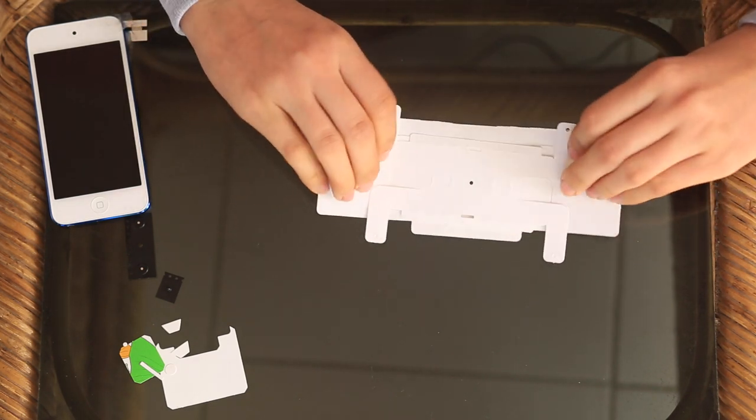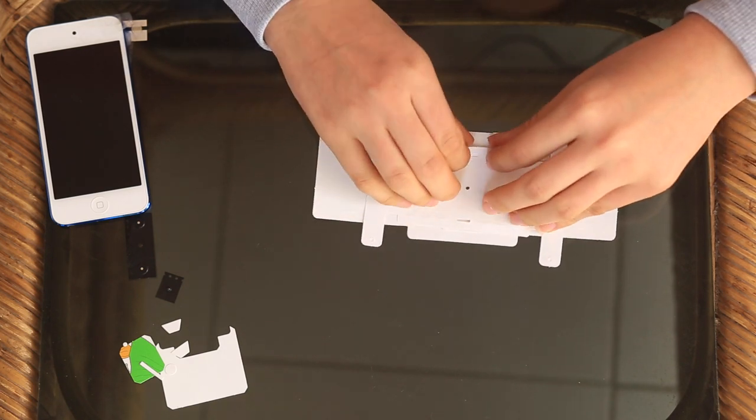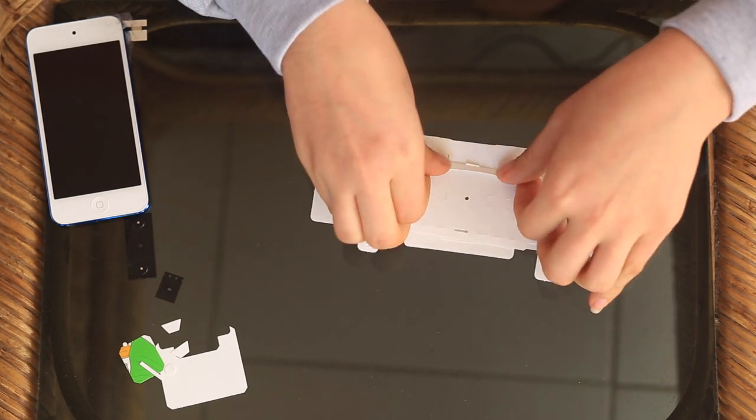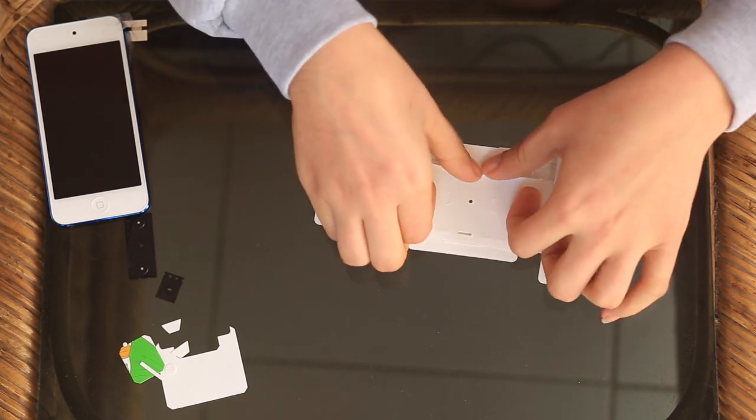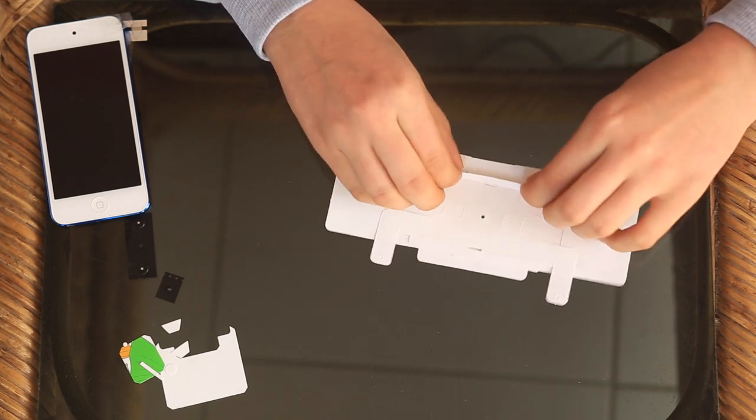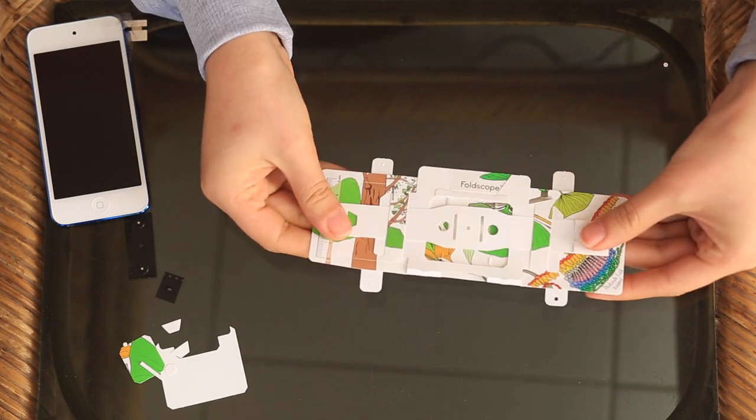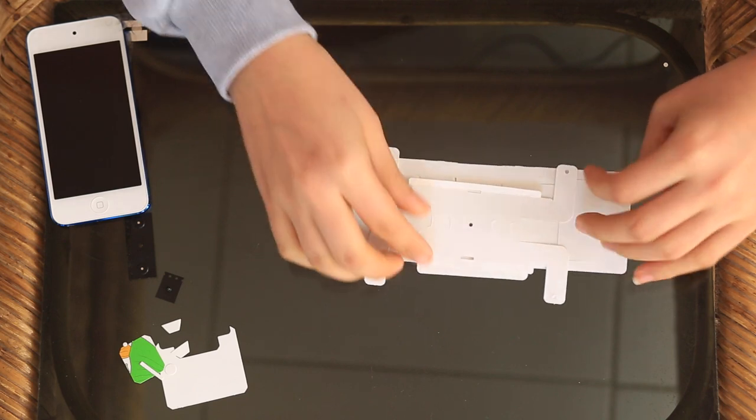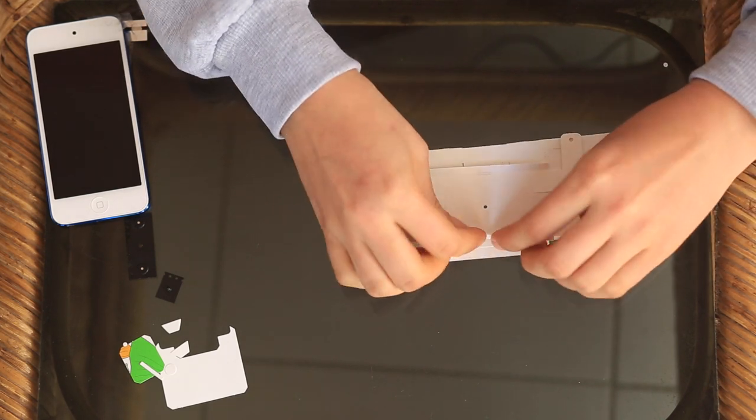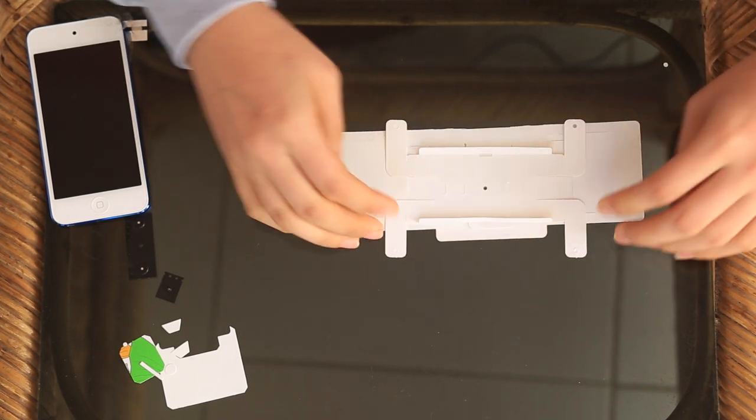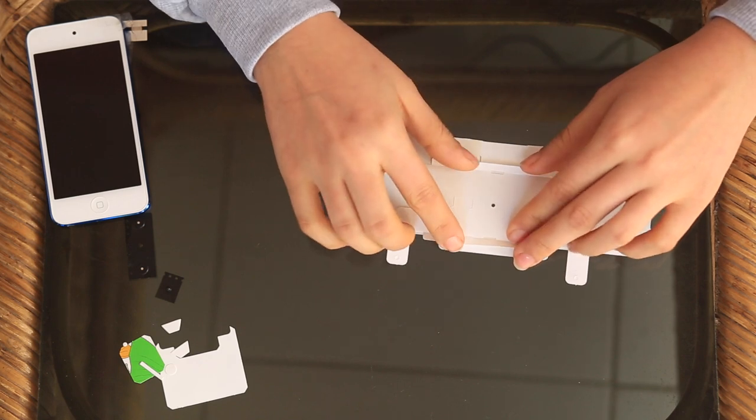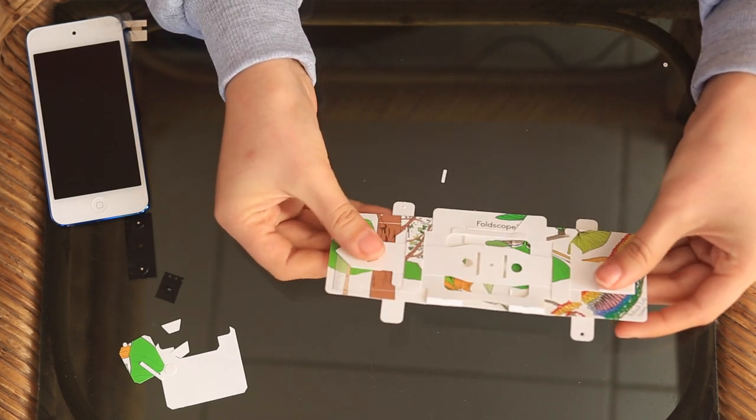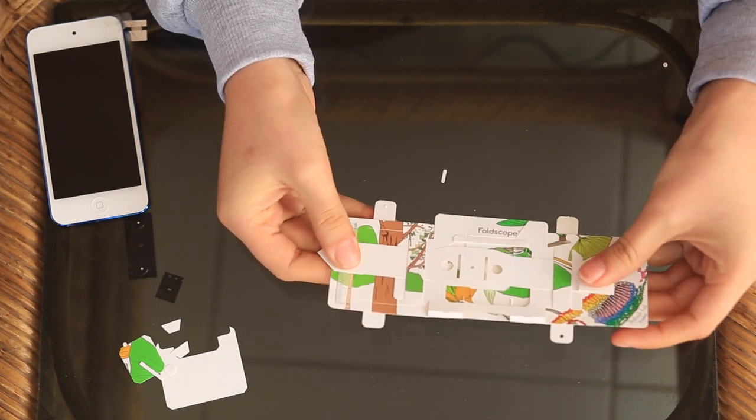One of the last steps is we fold it to the back again. Then you fold up these small edges. That just adds a little bit of stiffness so when you're focusing it doesn't bend as much. So you take both of those, fold them up like that. And that is a mostly completed Foldscope.